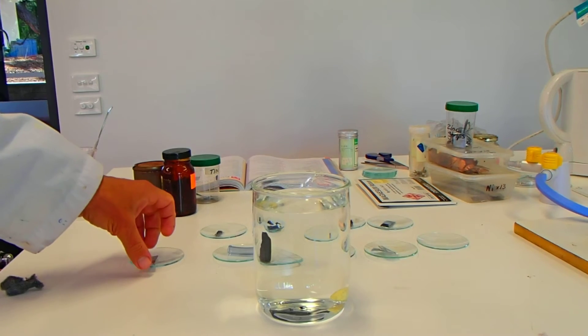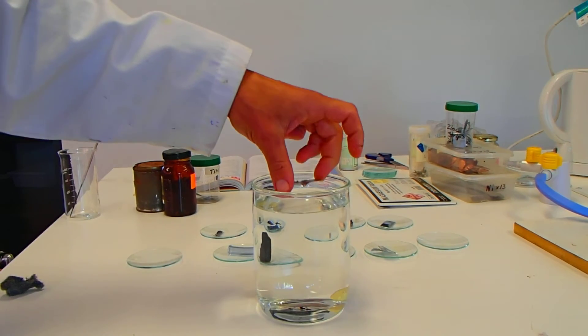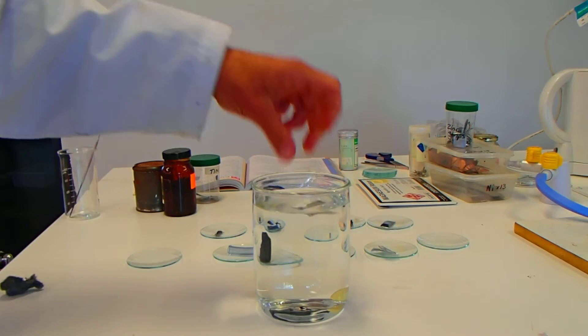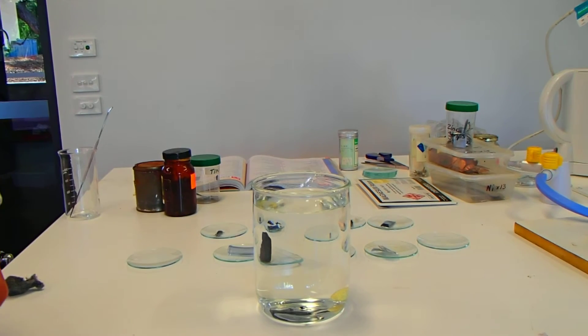We have some tin. Let's have a look. Does it float or sink? And no, that quite quickly sinks with the tin.